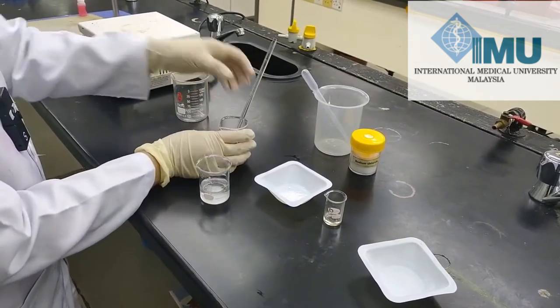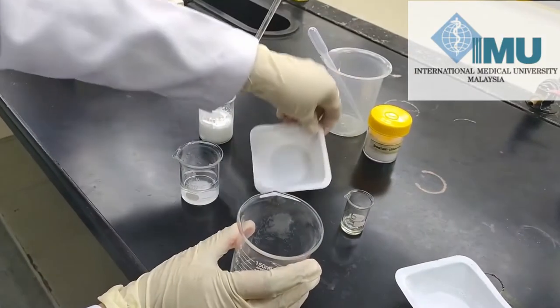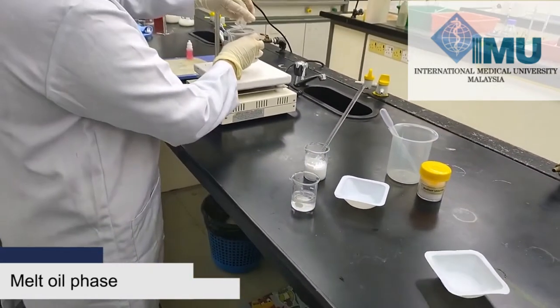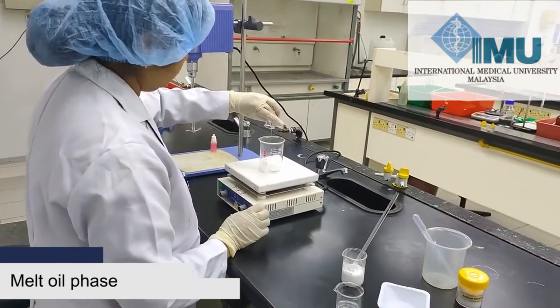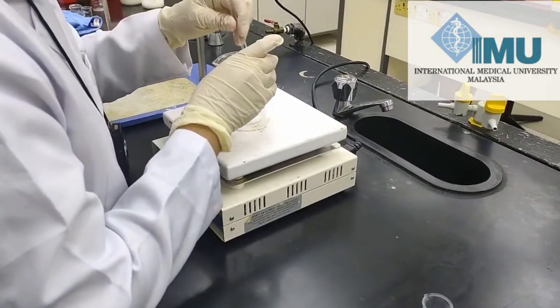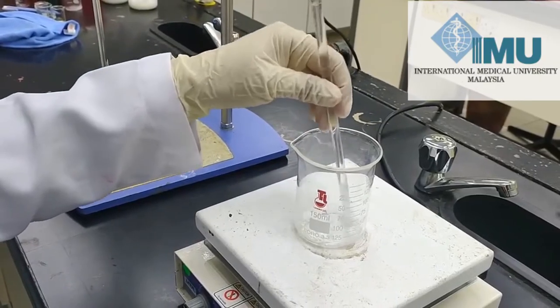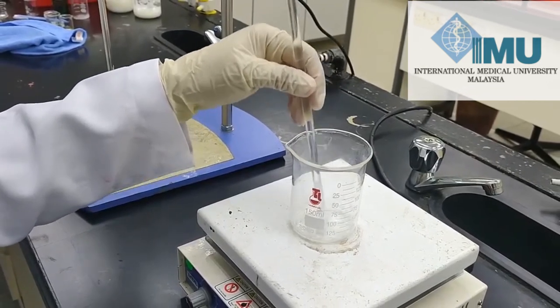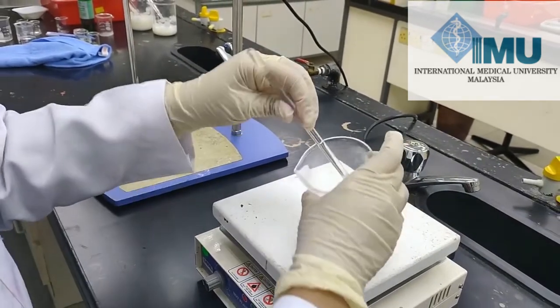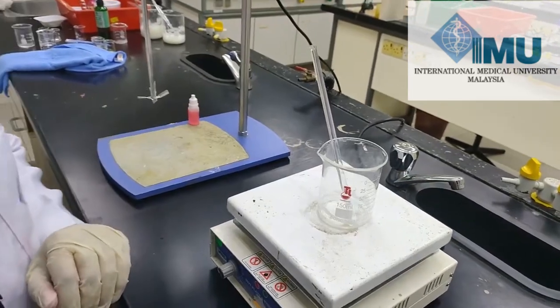The next step is to take the fatty content — ethylene glycol monostearate in a beaker along with coconut diethanolamide — and melt it. You can see the oily ingredient is melting here, and now our oily ingredient is already melted.